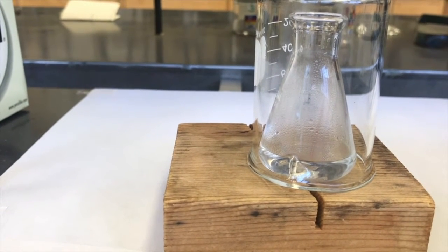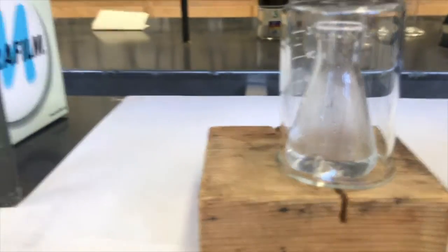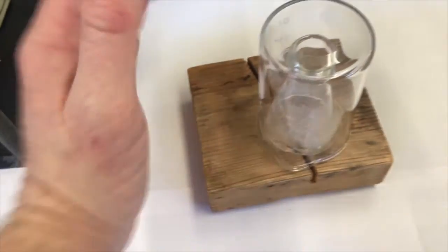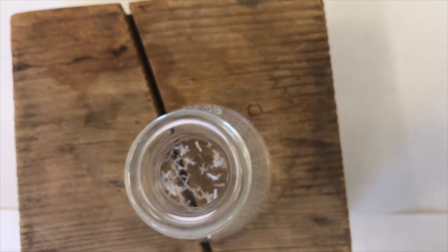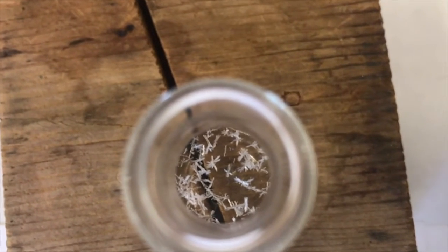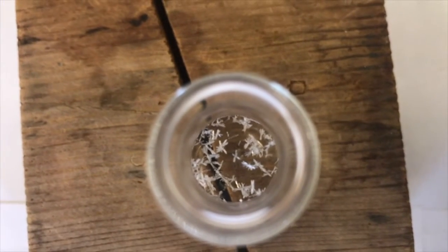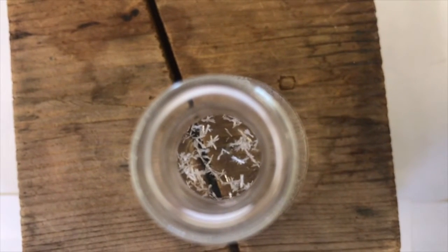And we'll let that go, and while that's cooling and crystallizing, I'll move back over to my aqueous layer. I'm coming to check the crystallization over here. Ooh, I think we have some crystals. Nice. Oh yeah, they look good. I'm gonna remove the beaker and let you watch it for a sec. It's cool the way they're twisting around, huh? Forming. I'll set up a video of this.